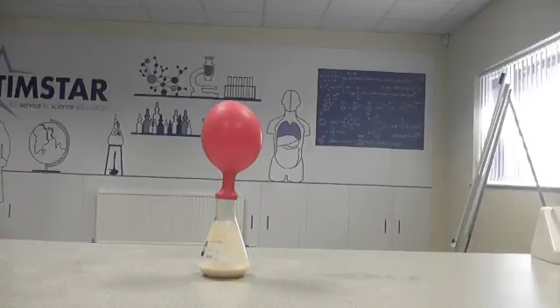This is after an hour. As you can see, this experiment is a success as the balloon has inflated.